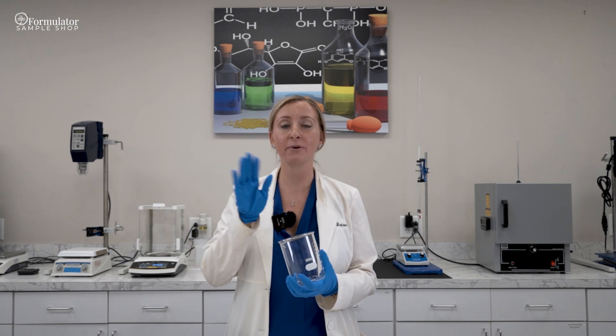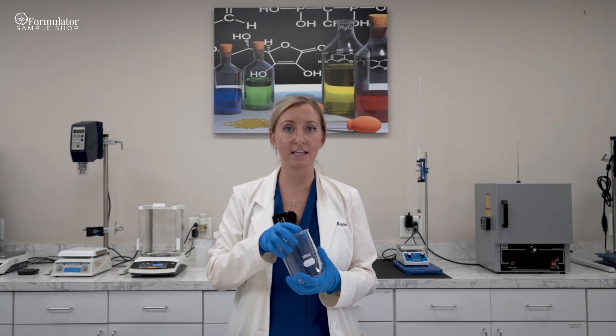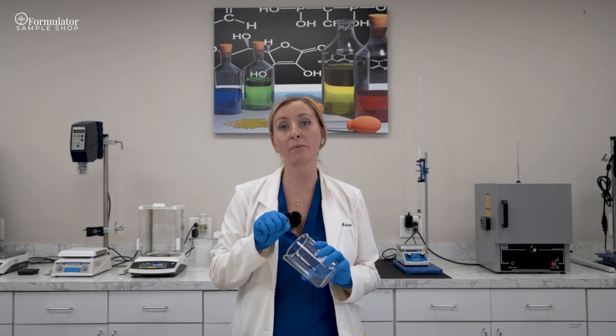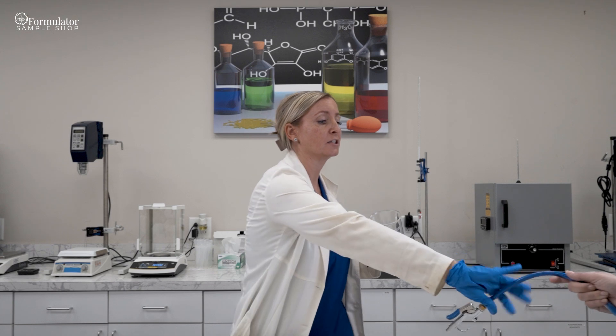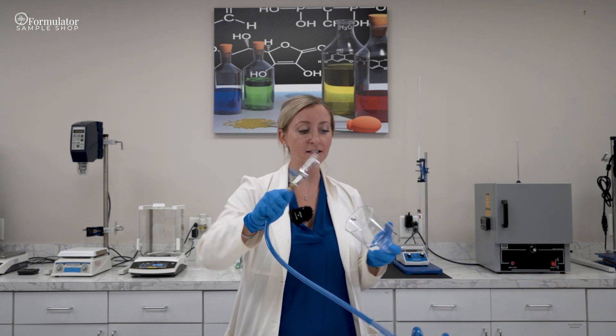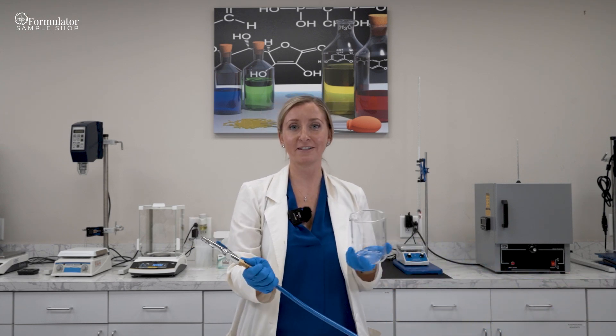Before you start and put any product in there, water, anything, you want to make sure that you spray it with compressed air. That'll remove any dust particles or other things that might have floated in there after you sterilized it. So you would use an air compressor just like this, spray your beaker, and then start your batch.